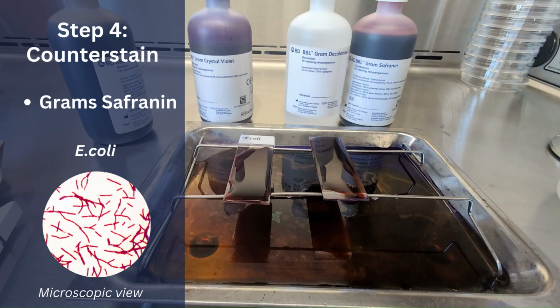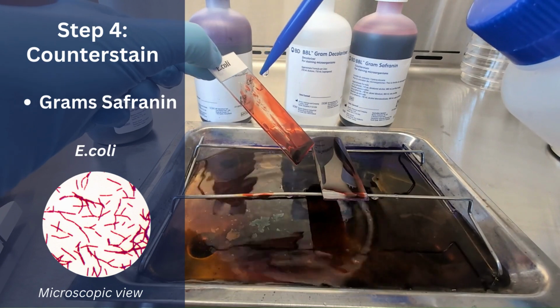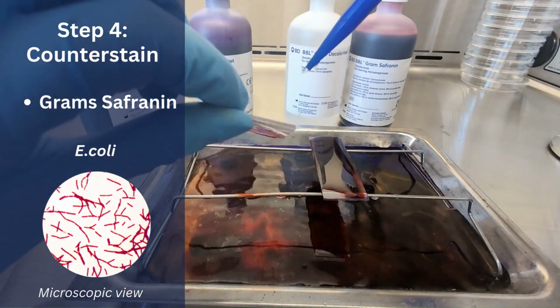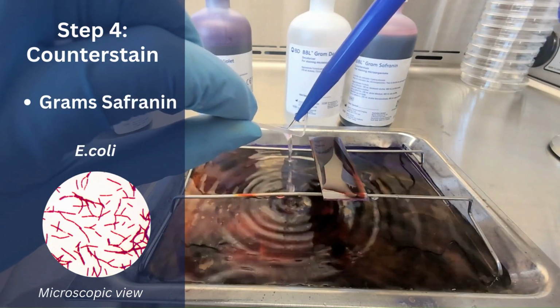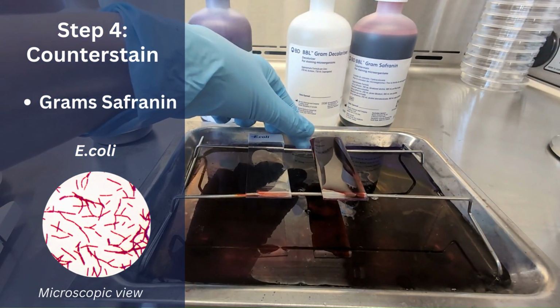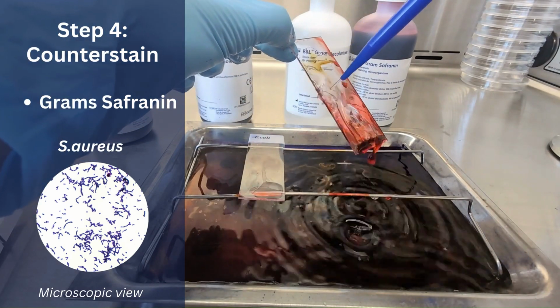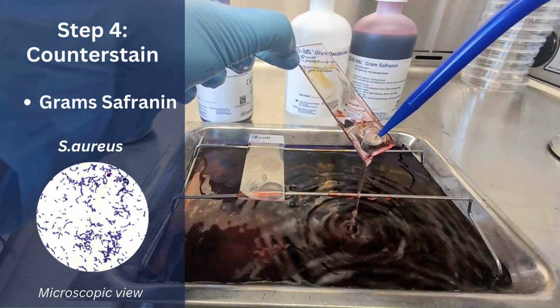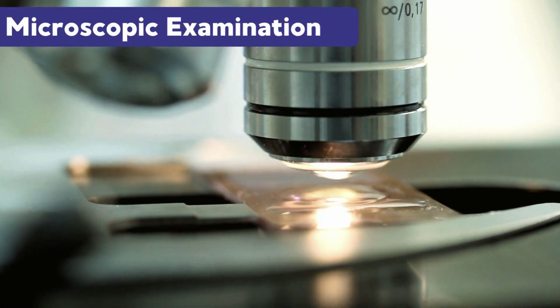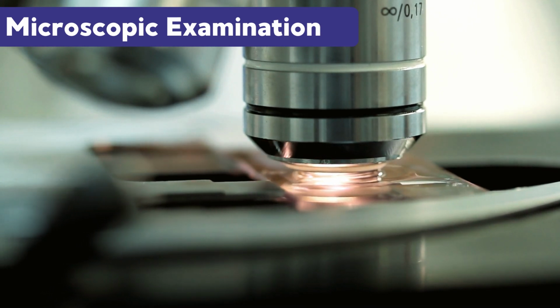The final step is rinsing off the gram's safranin. Upon rinsing, the E. coli, which is a gram-negative bacteria, will take up the counterstain and appear pink or red underneath the microscope. Staph aureus, being a gram-positive organism, will remain purple upon microscopic inspection. Your next step would be to prepare the microscope using the oil immersion lens. Let's take a look at our results.